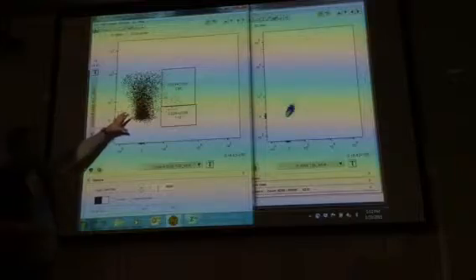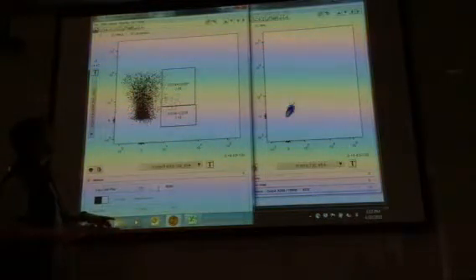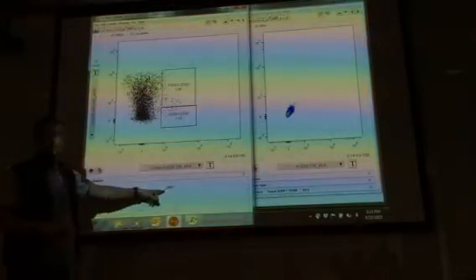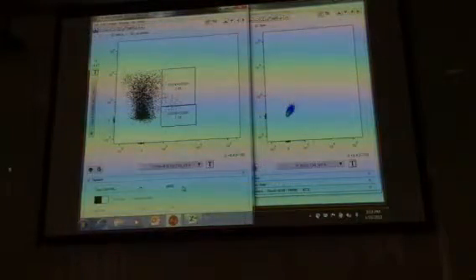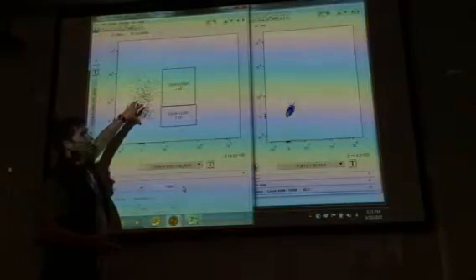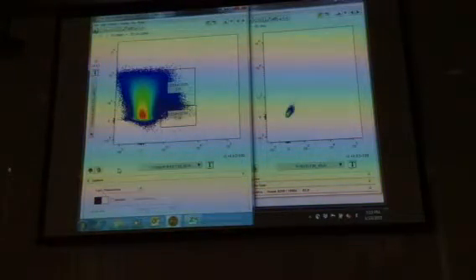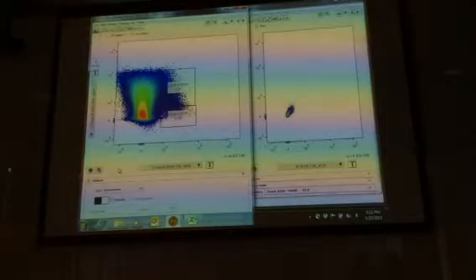When you show the dot plot, it's going to show you a certain number of dots. For example, here, I can't find where the data is right now, but it's only showing you 8,000 dots. You can actually change this number and you can show a different number. You could show even less if you wanted to. It changes it again, completely altogether. The data is still there. There's still the number of cells behind these different gates. It's just that the data that you're seeing and being represented is that. So that's sometimes why, particularly with the dot plots, it's best to go with a pseudo color plot, because it gives you a better representation, because it kind of gives you that heat map as well of it. Okay.